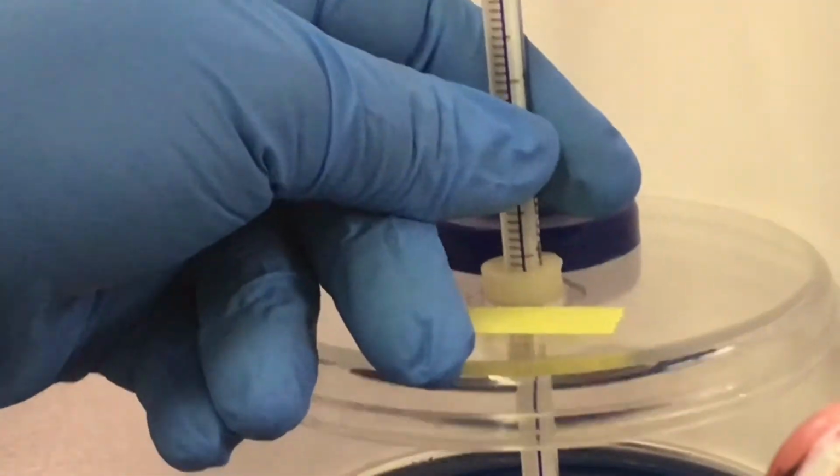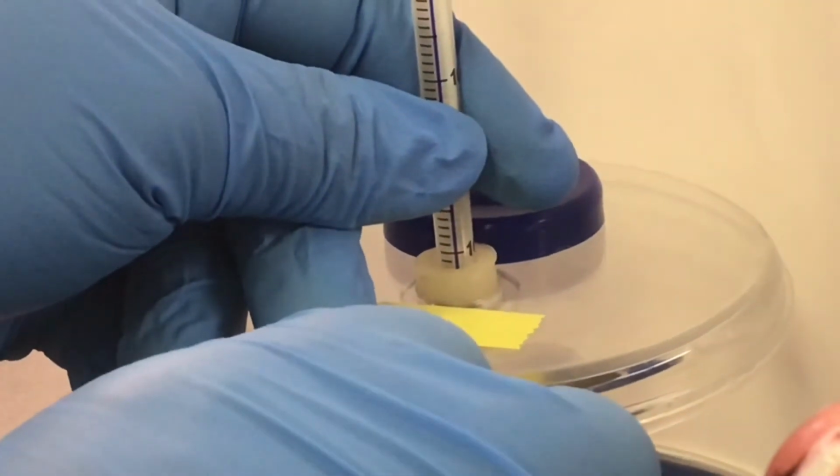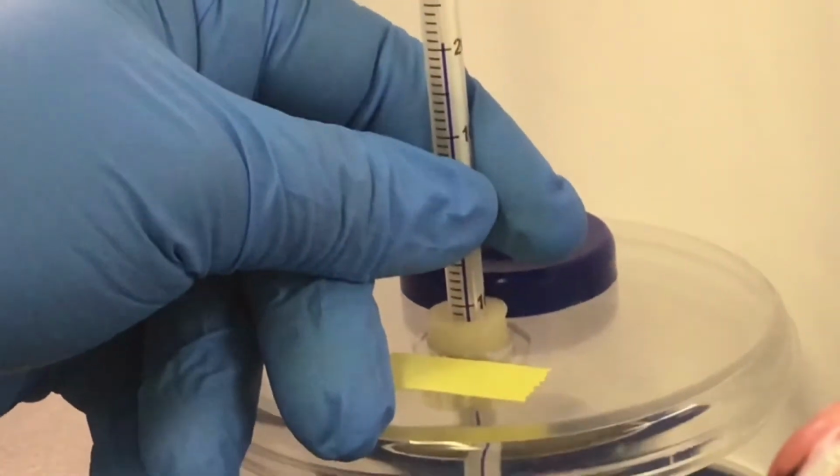Please pause the video and record the mass of the sulfuric acid. Next, we will measure the initial temperature of the water before we add the sulfuric acid. And please pause the video and record the initial temperature of the water. Then we will add the 5 milliliters of the sulfuric acid to the water and record the temperature changes that are associated with this process. Again, you will record the temperature readings for every 10 seconds until the temperature remains constant.